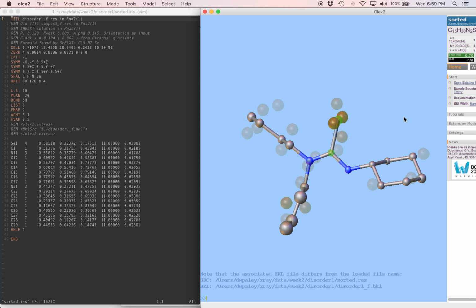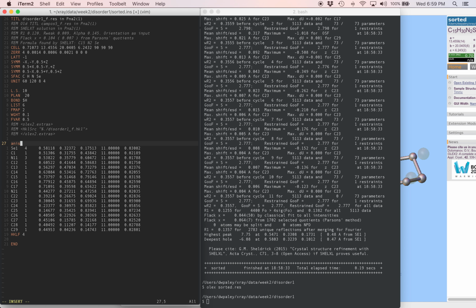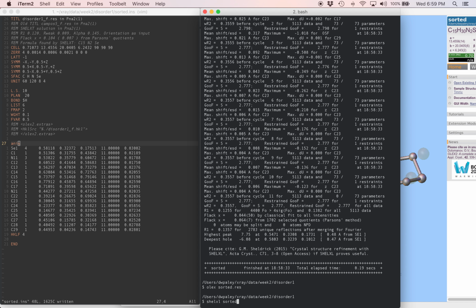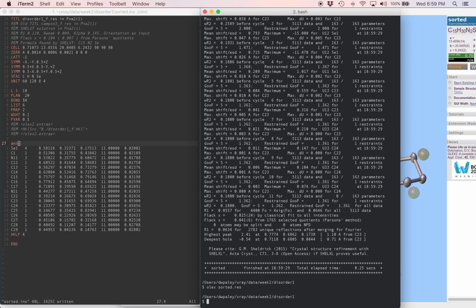So everything makes sense here, and as soon as we make that atom anisotropic, we should see a big difference in the R factor and in the difference map too. So that's the first thing we'll do. We'll just go down, put an anis instruction to cover all atoms in the structure, and we'll see what we get here. You can see the R factor dropped from 13 to 6%, so that's got to be a good sign.